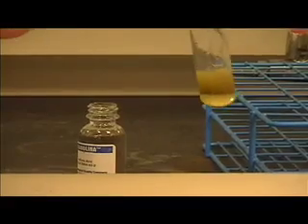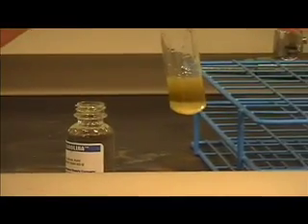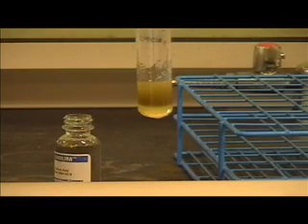Just put a few drops. And now, this test is called the brown ring test. Now, why is it called the brown ring test? Well, I'm going to show you right now. It's called the brown ring test because look up, there's a brown ring that forms. But why does this brown ring form? Well, when the two liquids meet, the brown ring forms because the nitrate anions are reduced to nitrogen monoxide, NO, and the nitrogen monoxide will then react with the iron 2 cations to form a brown compound, which is this.